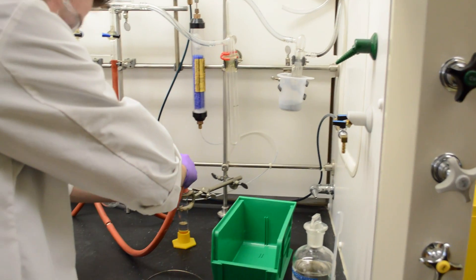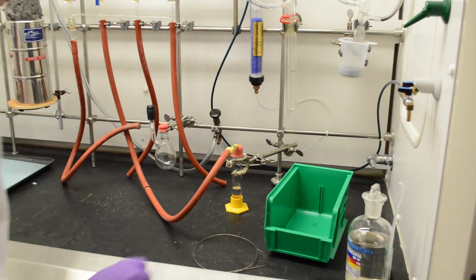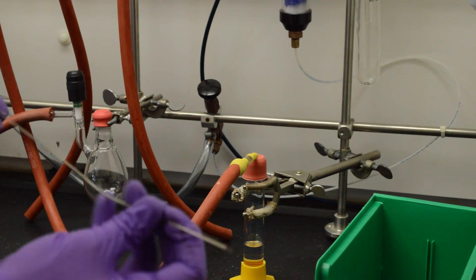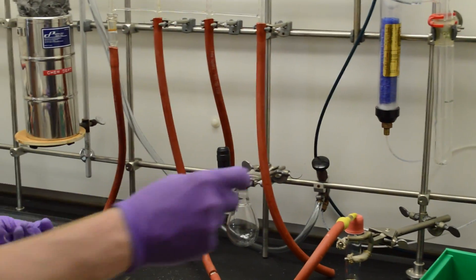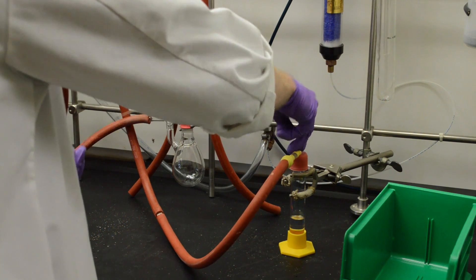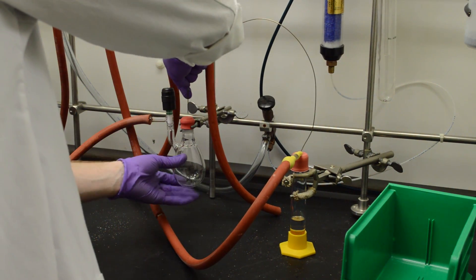So we can insert the needle through a septa here. And what we use now is a cannula, and this is just simply a long needle, which will allow us to push the solvents. So you can insert that into each of these two.